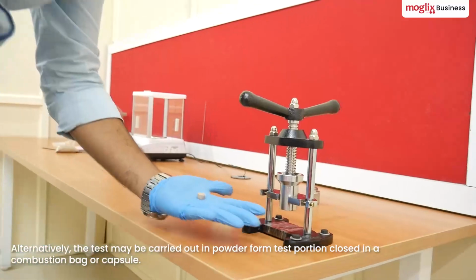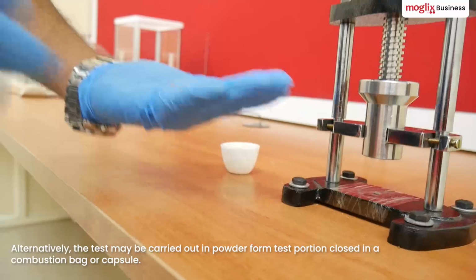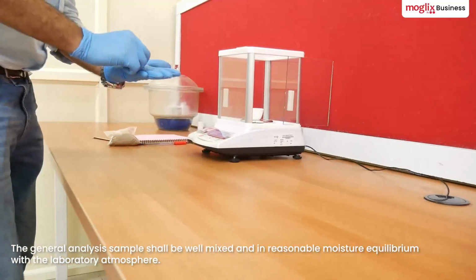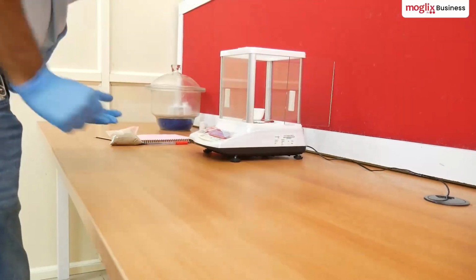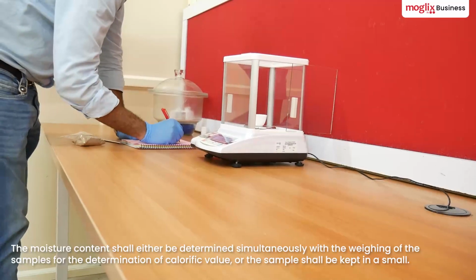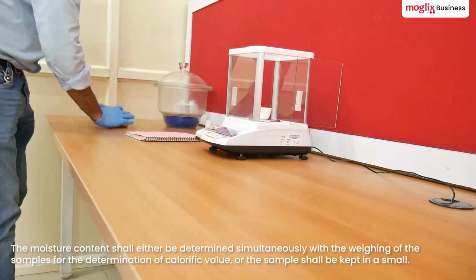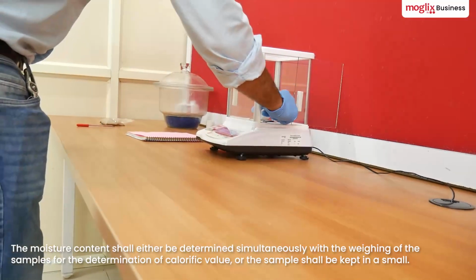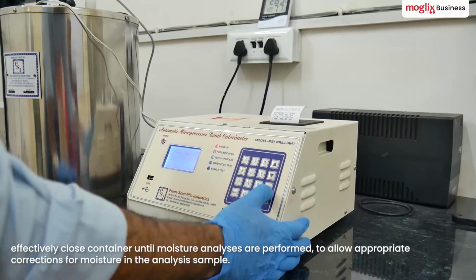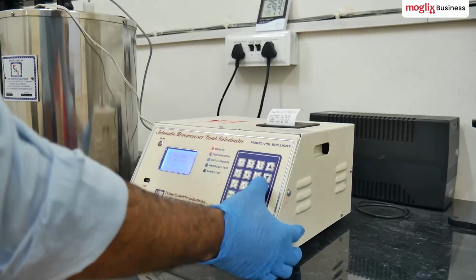Alternatively, the test may be carried out with a powder form test portion closed in a combustion bag or capsule. The general analysis sample shall be well mixed and in reasonable moisture equilibrium with the laboratory atmosphere. The moisture content shall either be determined simultaneously with the weighing of the samples for the determination of calorific value, or the sample shall be kept in a small, effectively closed container until moisture analyses are performed, to allow appropriate corrections for moisture in the analysis sample.